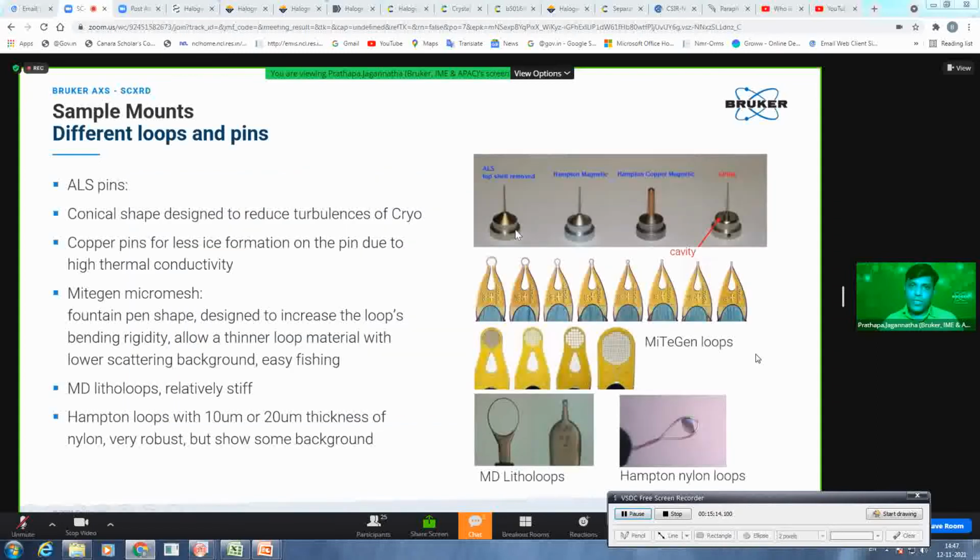So he can choose different kinds of loops. These conical shaped loops are better for stability, so it does not give you too much vibration, and a shorter length of these pins is also good because it gives stability. At the same time, a shorter loop length is also recommended because it does not give too much vibration to your crystal. And if you see these kinds of MicroMounts, they actually come with a kind of ink pen nib, which gives stability for your crystal, so it will not have vibration or movement while you are processing or collecting your data under low temperature.